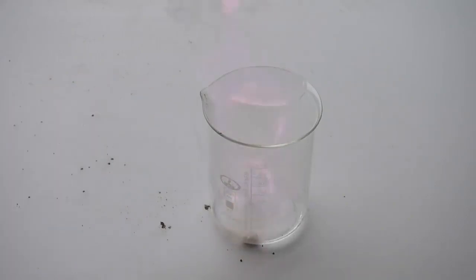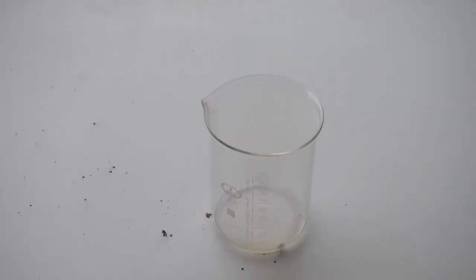If you throw a piece of cesium into a glass filled with ethanol, cesium will self-ignite, even in alcohol, coloring the flame of alcohol with beautiful purple due to cesium ions.